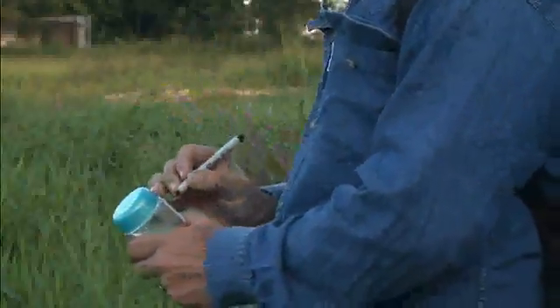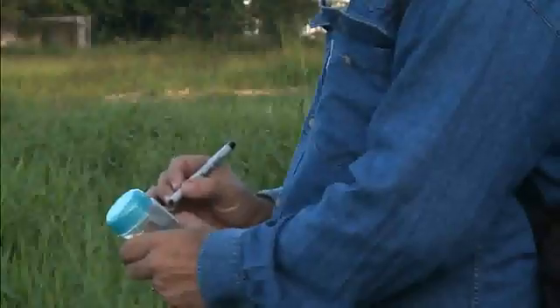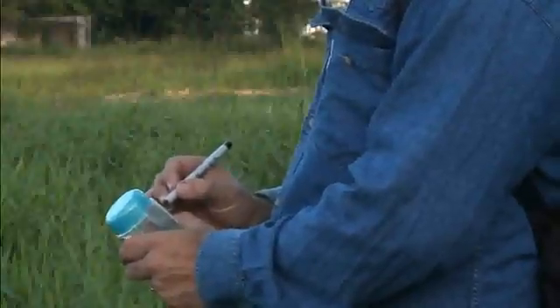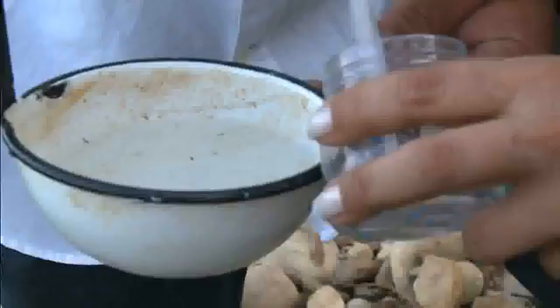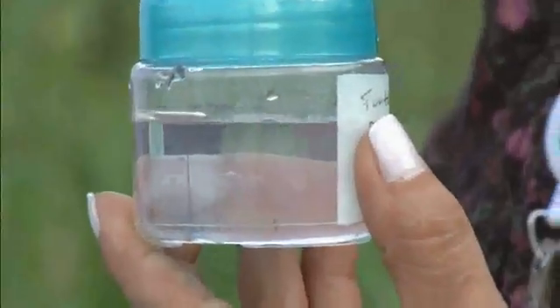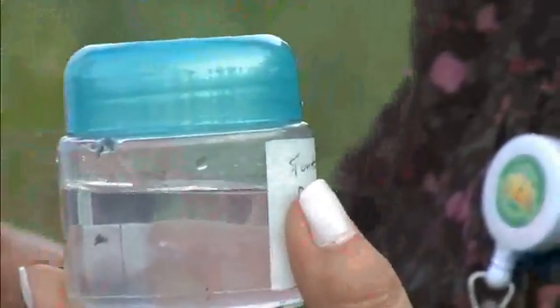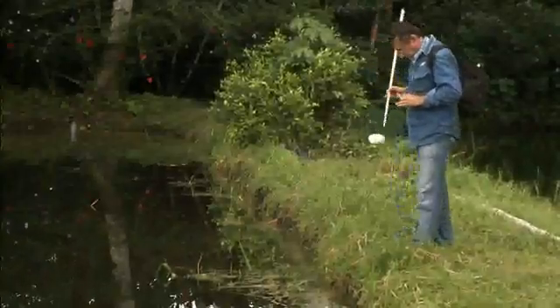The number of dips in each breeding place and the species of larvae found should be noted in order to calculate larval densities, which is the number of third or fourth instars collected in a specified number of dips. Larvae and pupae may be transferred with a pipette to a bottle or vial. Be sure to separate larvae from non-mosquito larvae. Do not discard the water back into the breeding site.